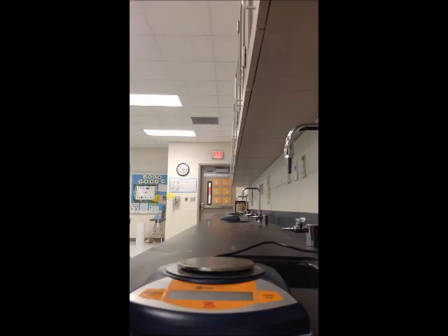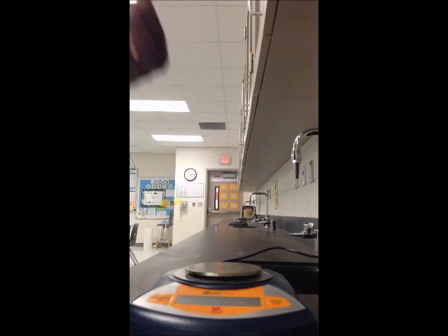Okay, in order for you to get the mass of the unchewed gum, you will need to subtract the mass of the cup from the unchewed gum. All right, go ahead and do that in your calculator. You should get 7.902 as your answer. Now we will chew the Hubba Bubba gum for 5 minutes. So I'm going to go ahead and do that. And I will set my timer.